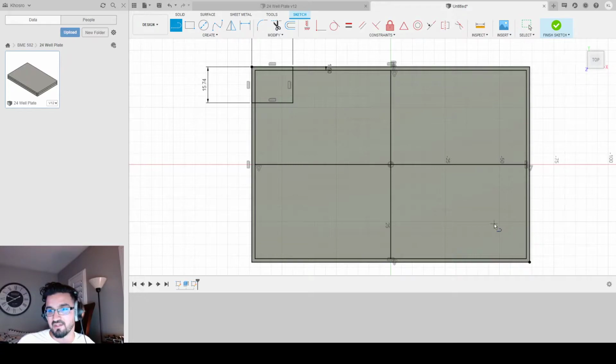Next, I'm going to just draw a simple line, cutting my plate into 4 regions. And the reason why I'm doing that is because I'm going to mirror this, because I'm a little bit lazy to draw rectangles all over the place. Plus I like speed, and this is more efficient. I'm going to mirror along the X and Y axis, so I have 3 centers of origin to rely on. Next, I'm going to create a circle here with a diameter of, let's go 17.